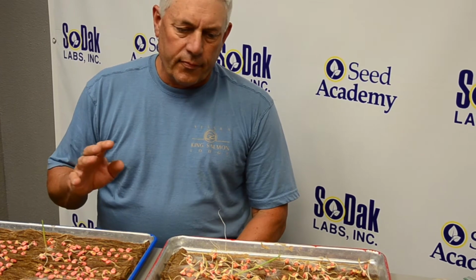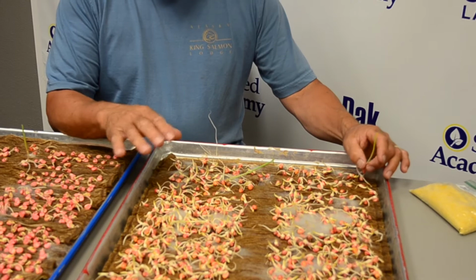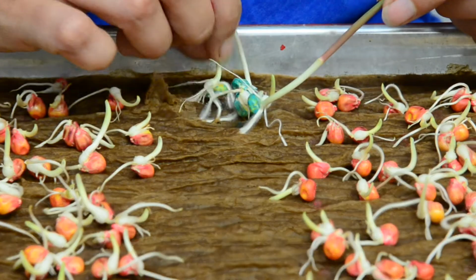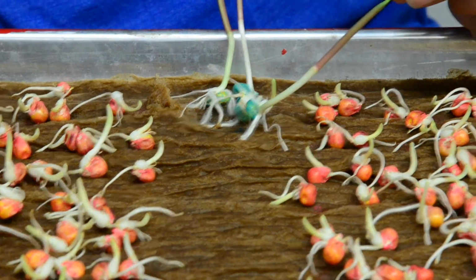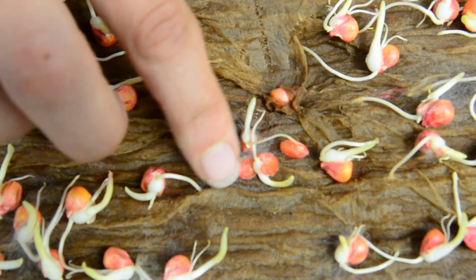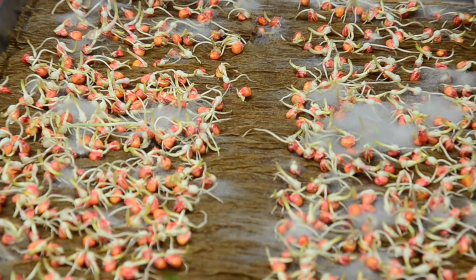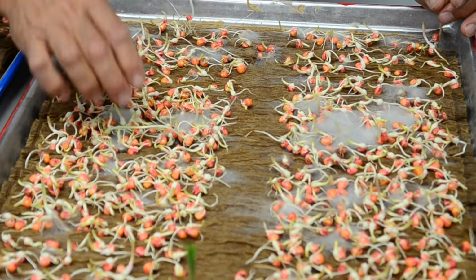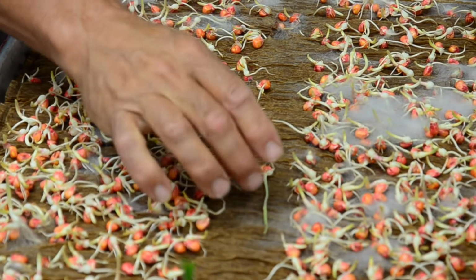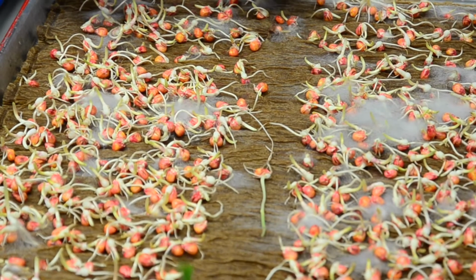The reason being, if you look here at this glyphosate test, we have 1,200 seeds planted. You have a positive check that has a glyphosate trait here. You see these check seeds. We have some negative popcorn seeds back here. And then we have the test sample. In this test sample, there happens to be, and this one just fell down, but you can see it maybe a little bit, 3 that have the glyphosate trait.